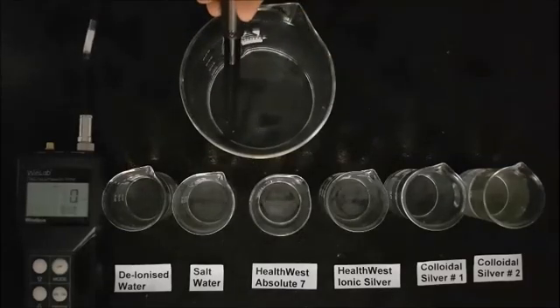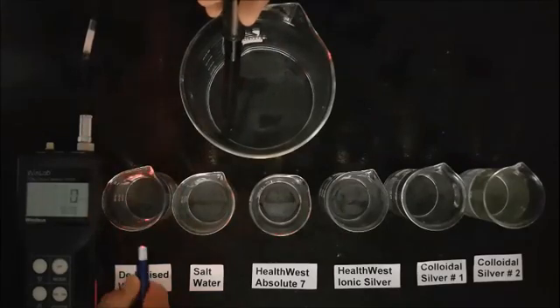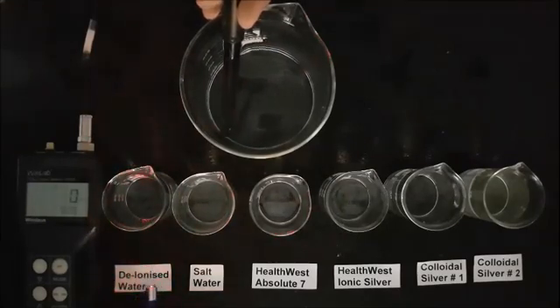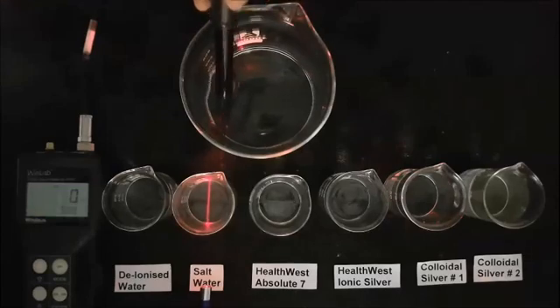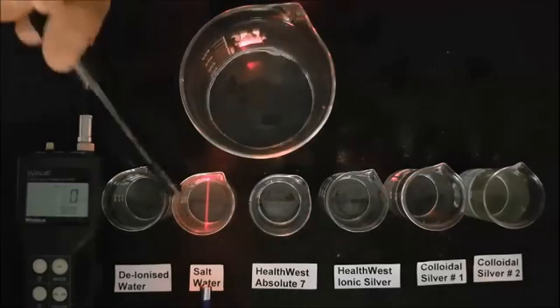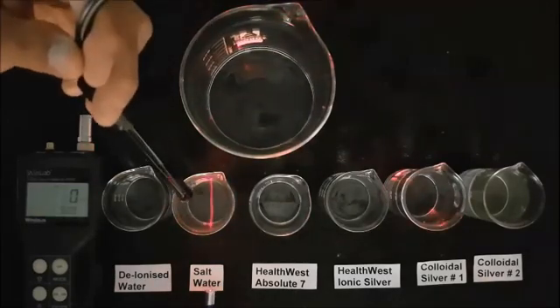The first beaker contains deionized water to be used as a reference. The second beaker is a salt and water mix to show what can be seen when a laser is shone through water with impurities in it.